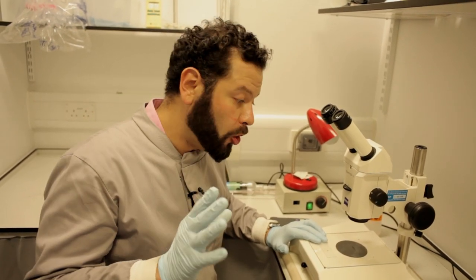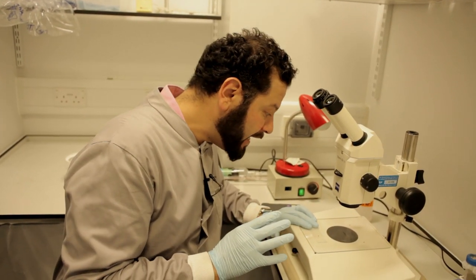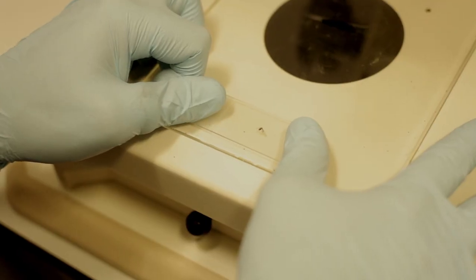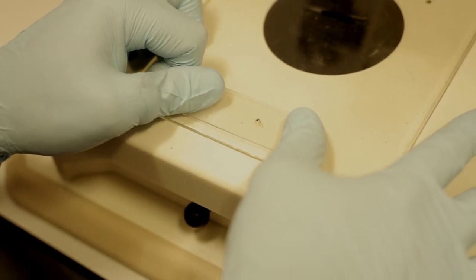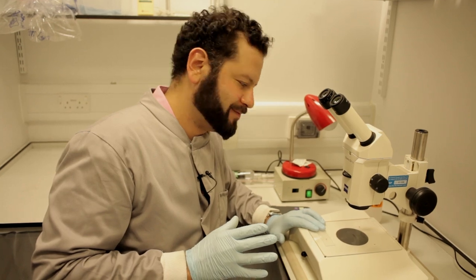Before we start, please note the size of a sand fly. It's tiny — it's about two millimeters long. Now, imagine trying to perform surgery on an animal this size.